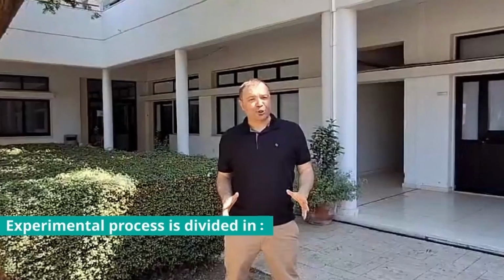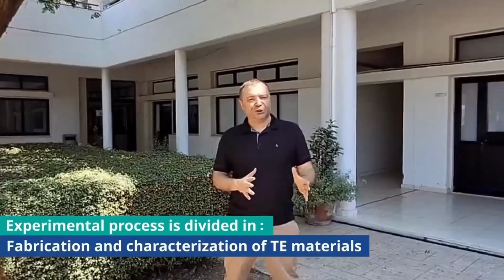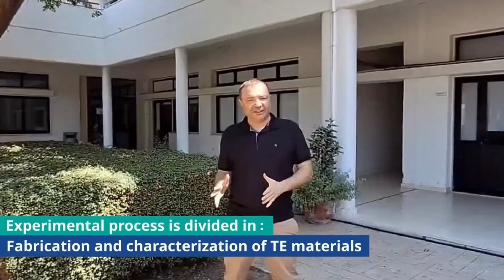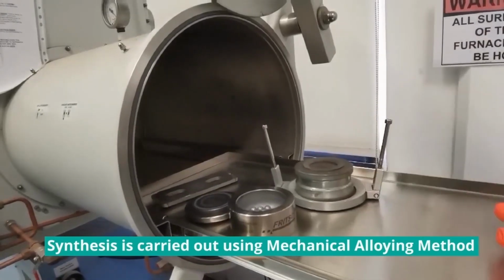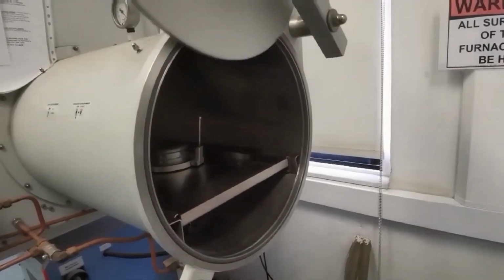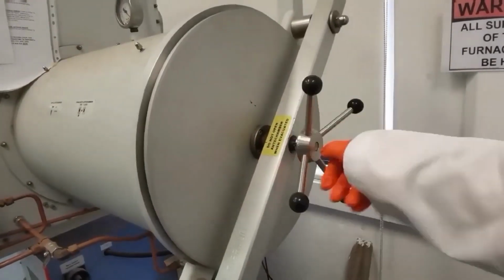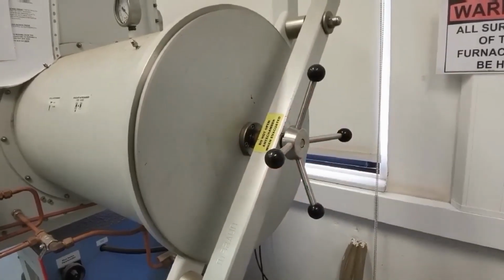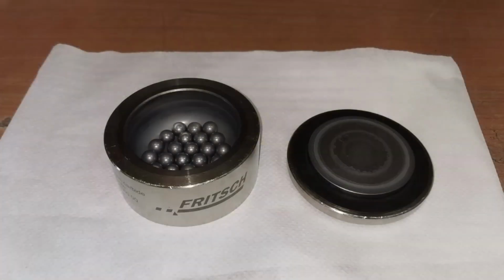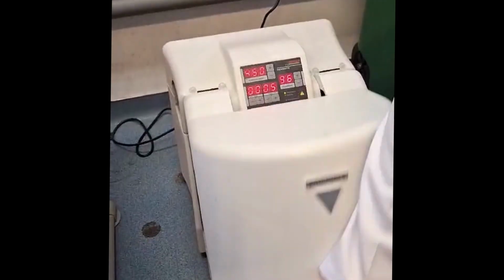The experimental process is divided into the fabrication and characterization of thermoelectric materials and the development and characterization of thermoelectric modules. Let's start with the fabrication of thermoelectric materials. Its synthesis is carried out by using the mechanical alloying method. Appropriate stoichiometric amounts of reagent elements are mixed in a glove box, and ball milling takes place for several hours, depending on the composition, under argon atmosphere.